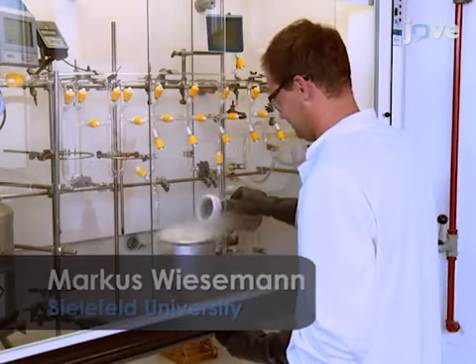Demonstrating the sample preparation procedure will be Markus Wiesemann, a graduate student from the Inorganic Chemistry department of Professor Hoge.